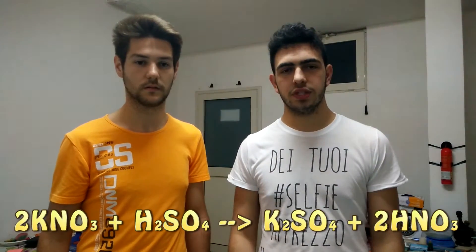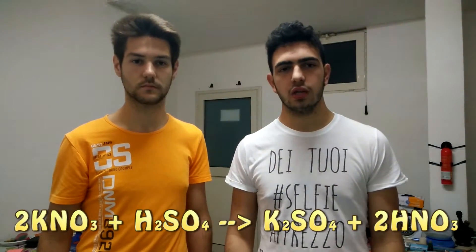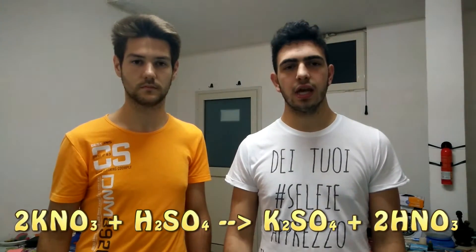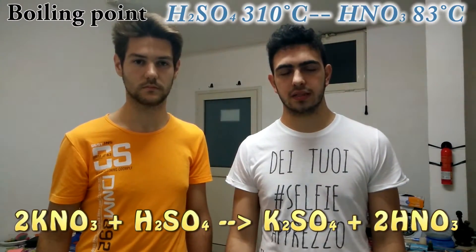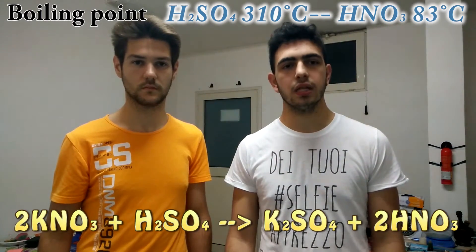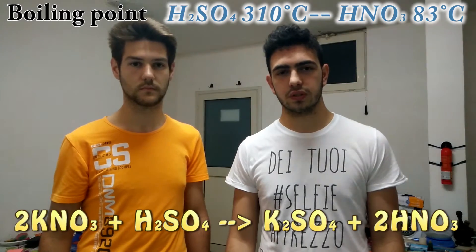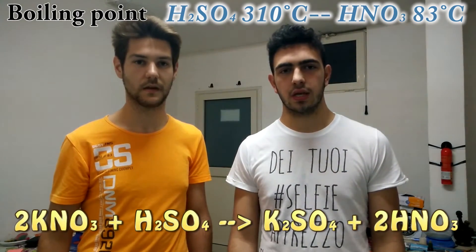What is happening in the boiling flask is the reaction in which the sulfuric acid reacts with potassium nitrate to form potassium sulfate and nitric acid, which has a low boiling point and becomes a gas since we are heating it. When it comes in contact with water it condenses and arrives to our receiving flask.